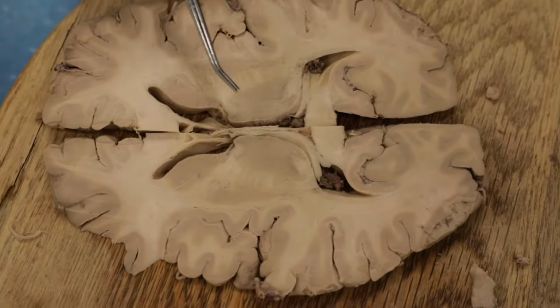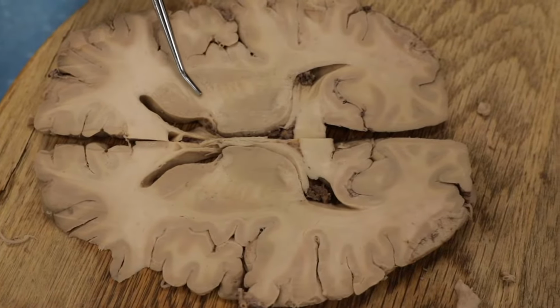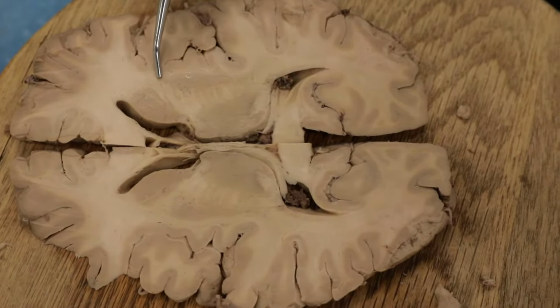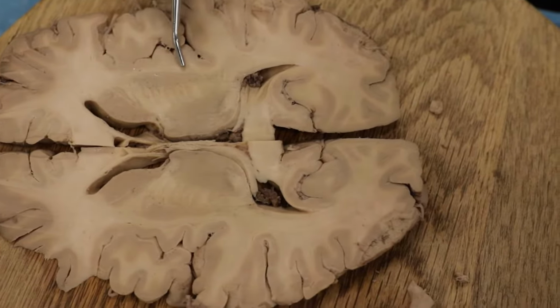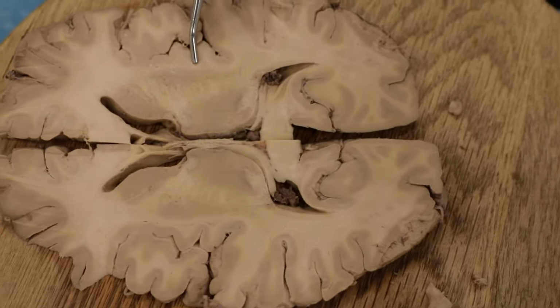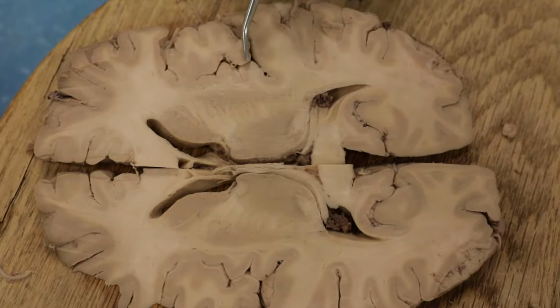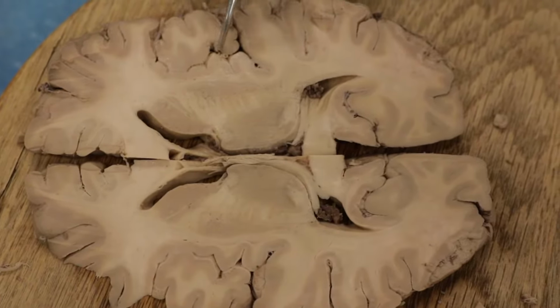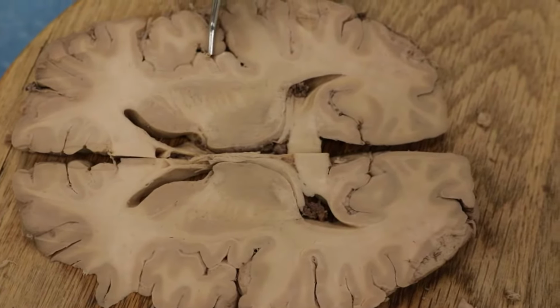All right, so let's just point out again here that medially we have the caudate and the thalamus, then we have the internal capsule, and then the putamen, and then again we have these white matter pathways, the external capsule, the claustrum, a little bit of gray matter right there, the extreme capsule, so that white matter right there, follow that all the way around, and then finally the insula. There's the insular cortex. And then the space out here again is the Sylvian fissure. Blood vessel in the Sylvian fissure has to be middle cerebral artery.